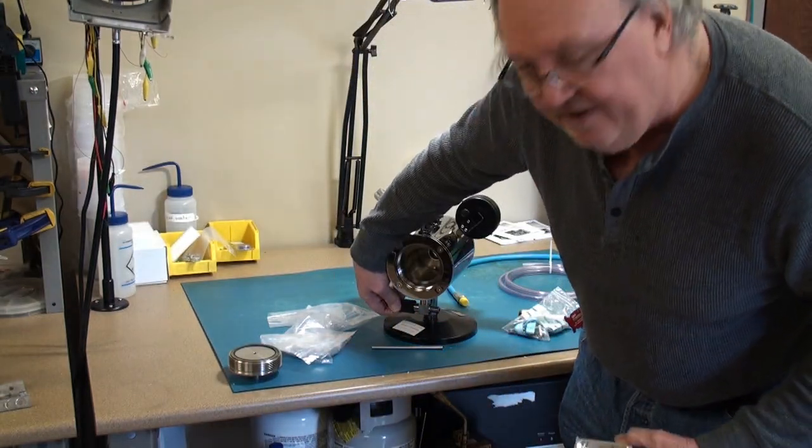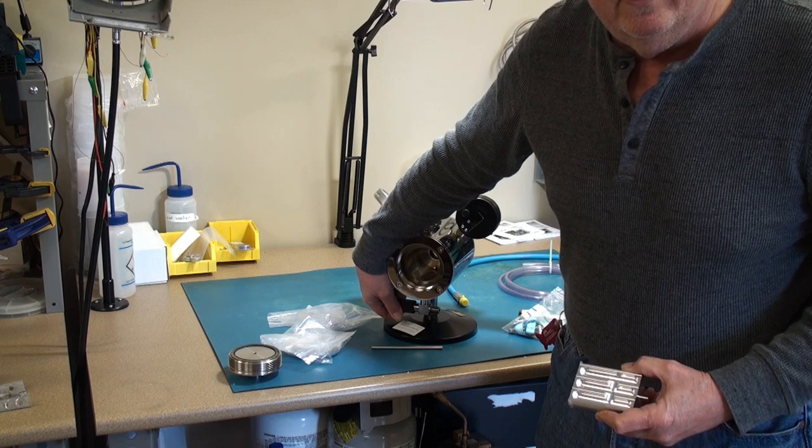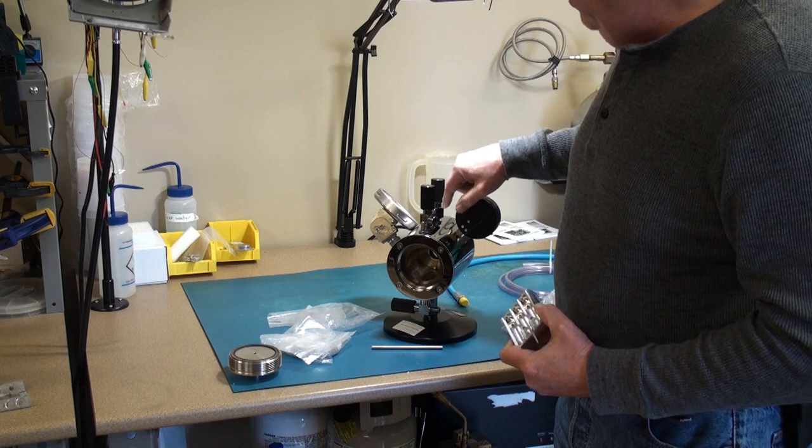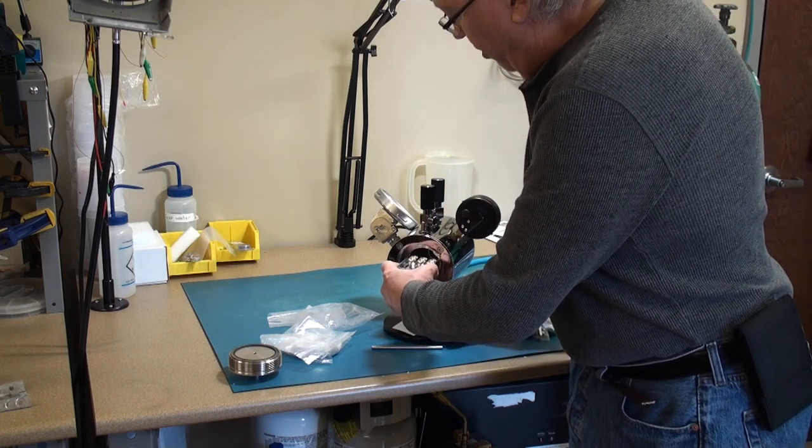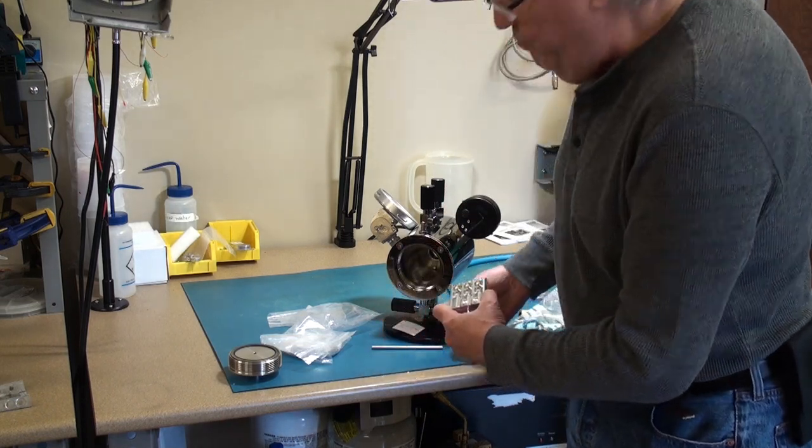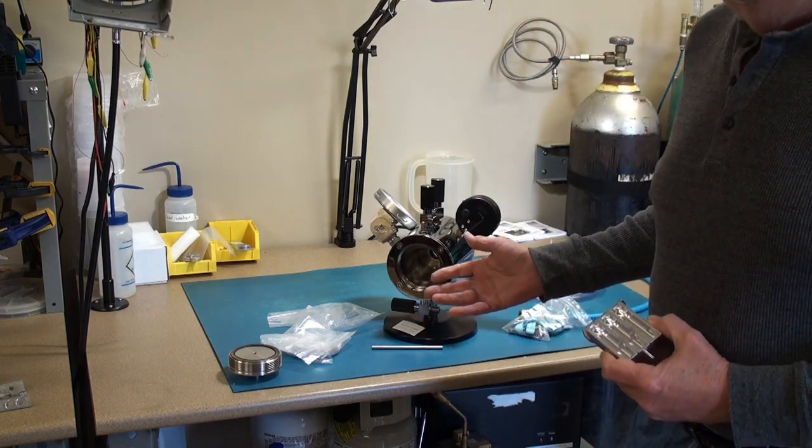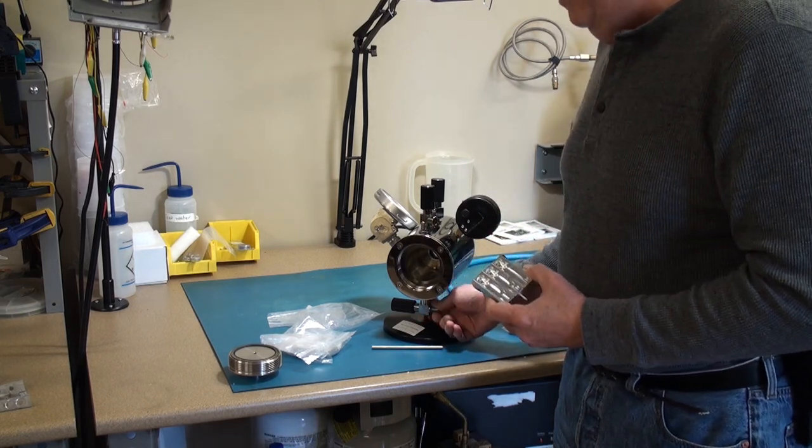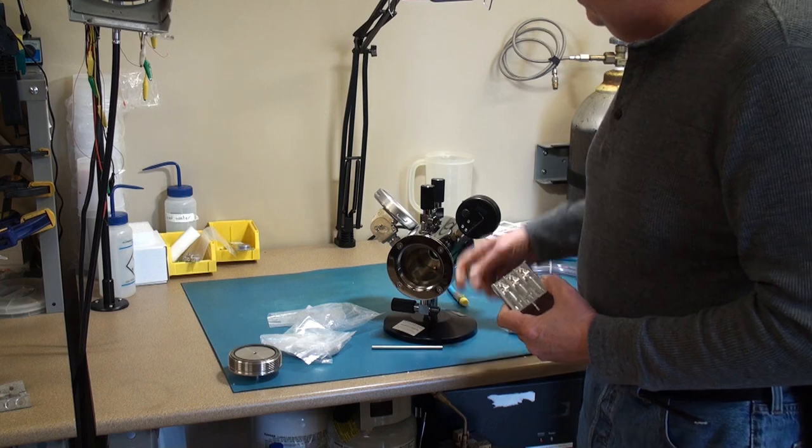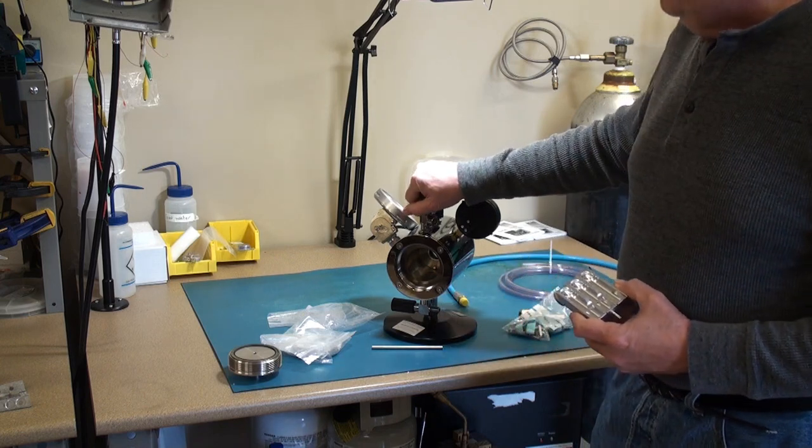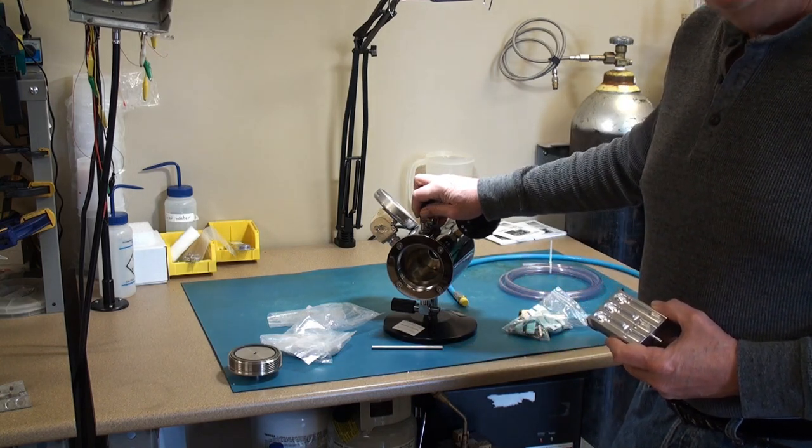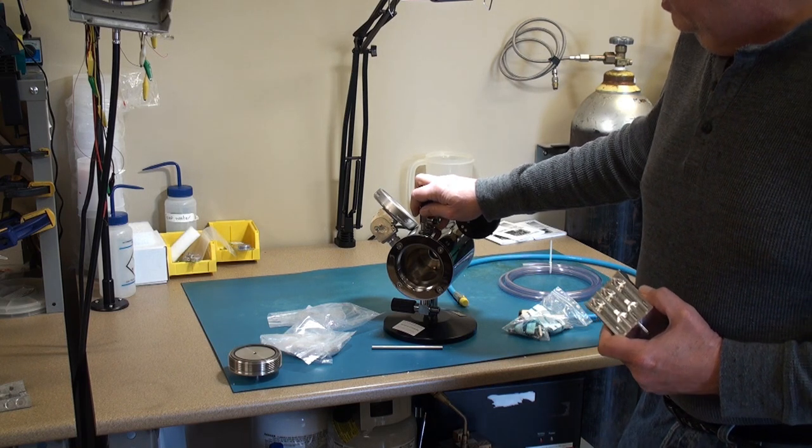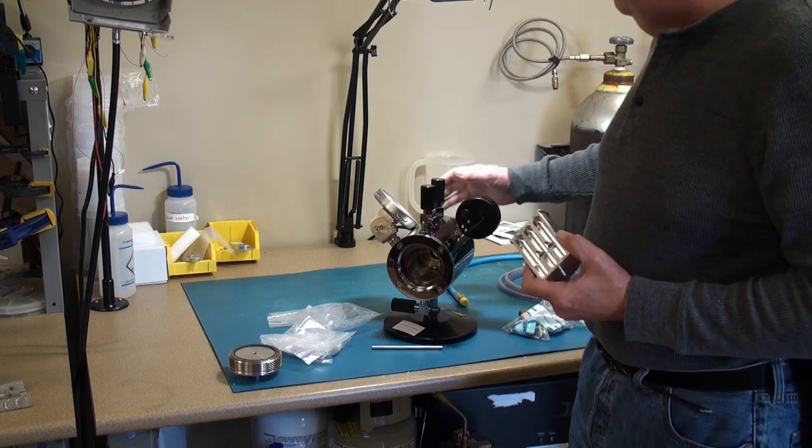That brings me to this back valve which is the drain valve. So you let your CO2 enter. Your alcohol drains out the bottom when you do some flushing with the CO2. Then you keep this valve closed for the remainder of the process. And when it comes time to bleed the pressure off you use this back valve. So that's essentially the overview of the system.